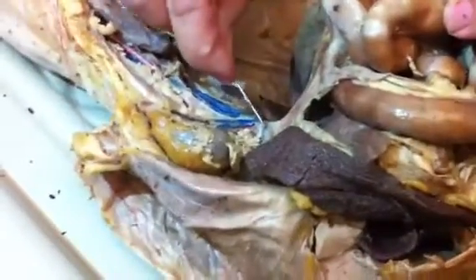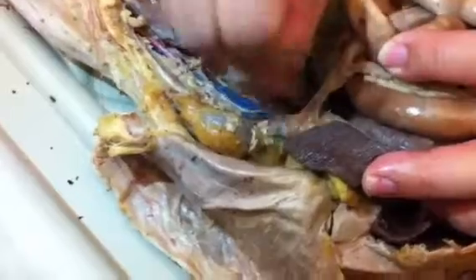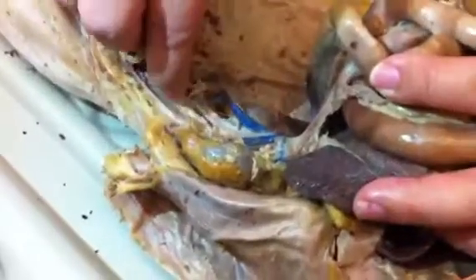And we have the kidney. So what's hanging off it has to be the renal veins and arteries. And the one superior to that is the suprarenal. And that goes to about here, but it's kind of beat up. And if you can see, it goes to about here, where the adrenal gland should be. This is the inferior vena cava.